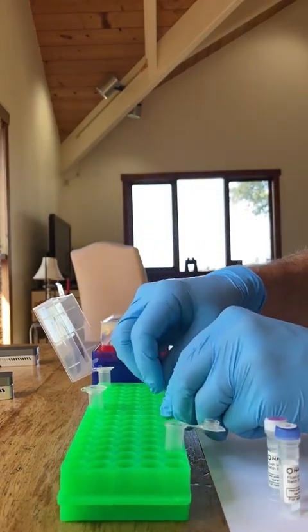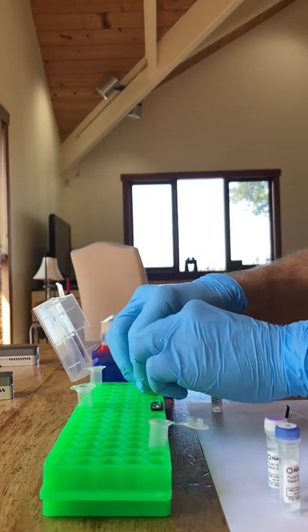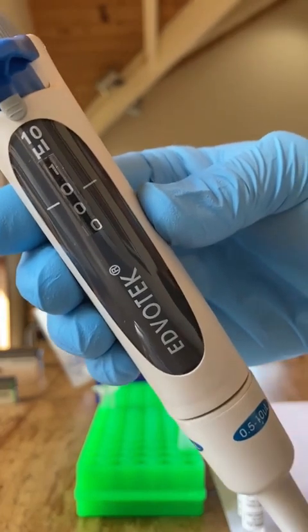So now I've just showed you tube 2 and tube 3. I've gone ahead and made a little hole in those as well, so it's just easier to insert the pipette tip when I start moving volume, reagents of volume there. Okay, so how much DNA do we put in tube 1?